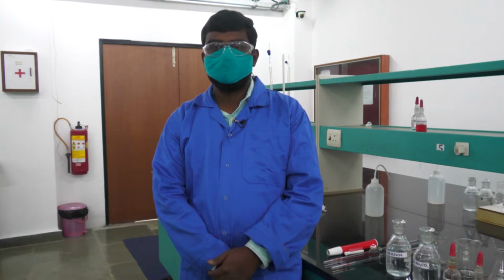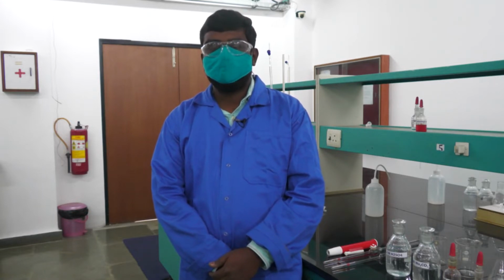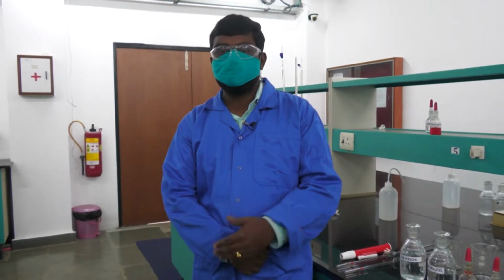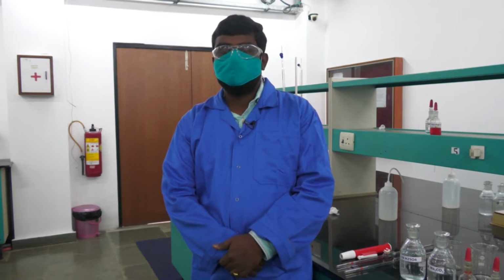Today I am going to demonstrate experiment 1. The title of the experiment is Acidimetry Alkalimetry titration. It is under the preparatory chemistry course. The main aim of the experiment is to estimate the amount of sodium hydroxide present in the solution. We have also provided 0.1 normal sodium carbonate and approximately 0.1 normal H2SO4 solution.